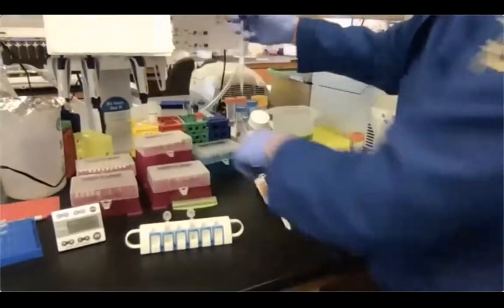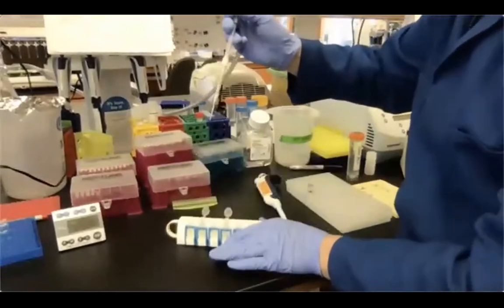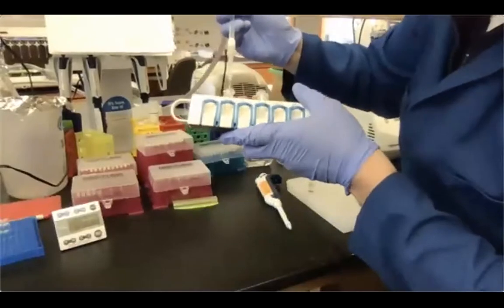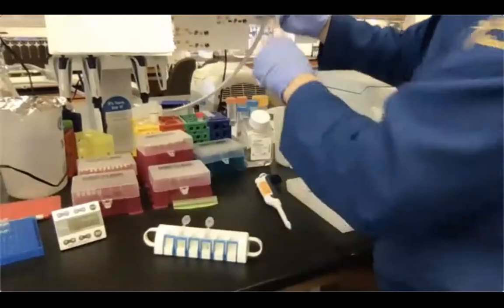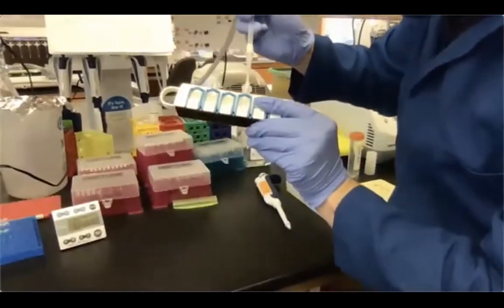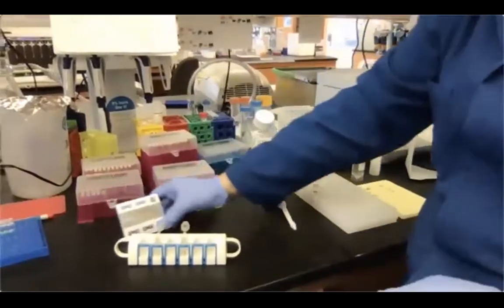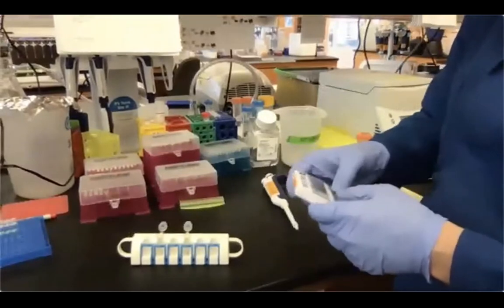All right, so time is almost over. So I'm going on the opposite side, same as before. Go all the way to the bottom. And then I'm looking for droplets that are around here. It's pretty clear. And also here, the other one. All right, everything is fine. Okay, so let's give it about, let's say 3-4 minutes, and then we are gonna check it again.